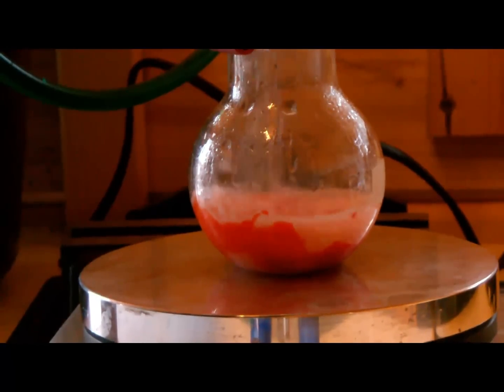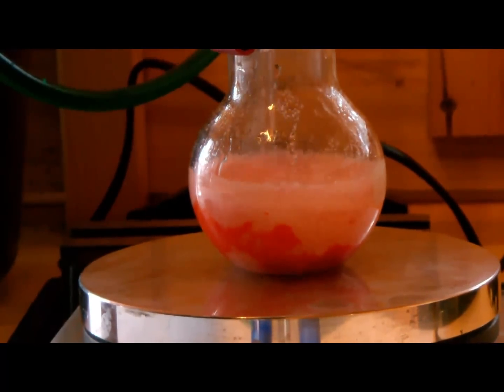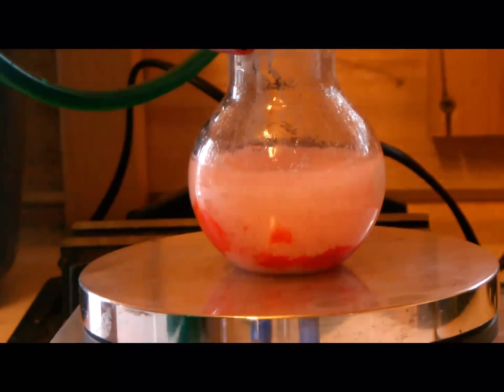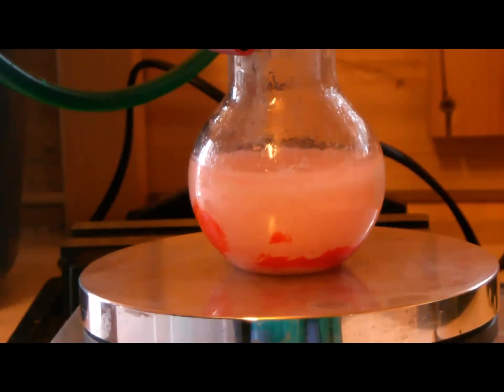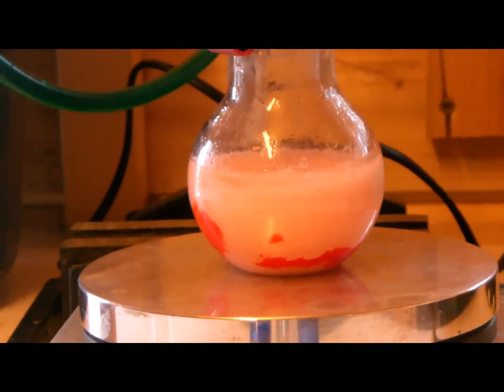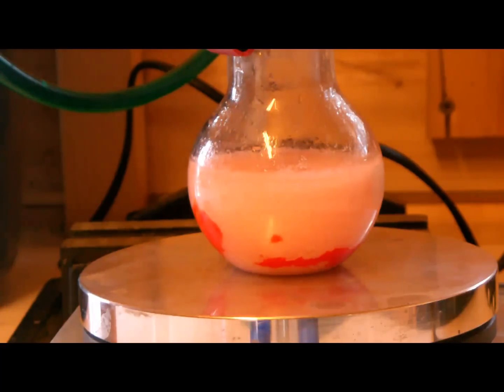Now what you have to do is add about 75 milliliters of distilled water so the phenolphthalein precipitates out. It gives its proton to the water, so the red form disappears. The unreacted phenol and phthalic anhydride go into solution so you can separate them from the phenolphthalein.